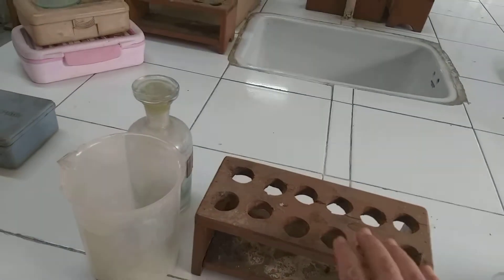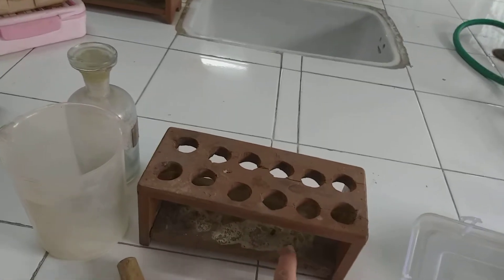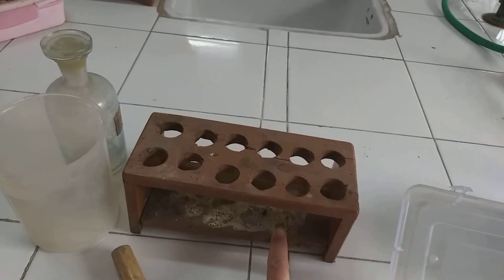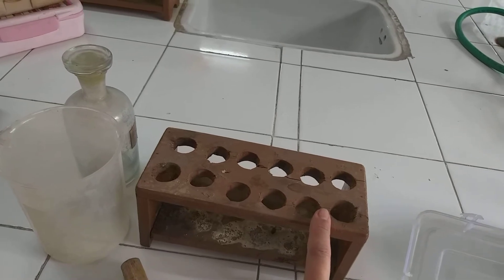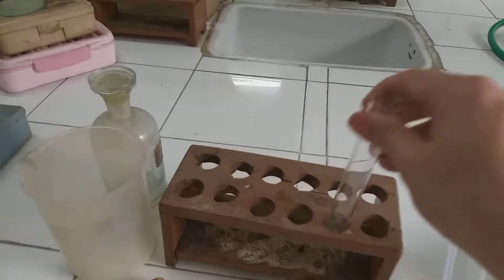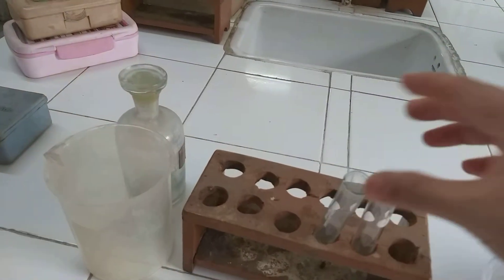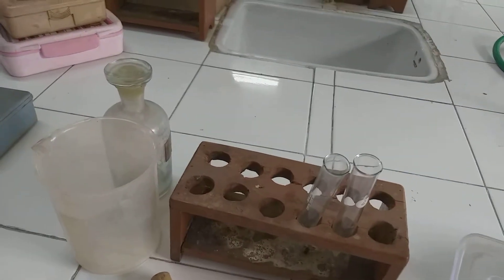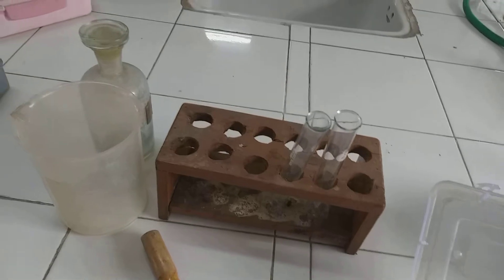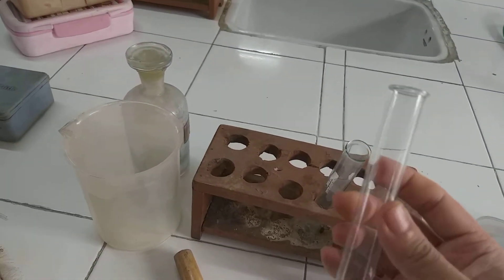Plastic stands are better because wood can react with certain chemicals, as you can see here, but plastic usually does not react. So we use it for keeping the test tubes. These are the test tubes.